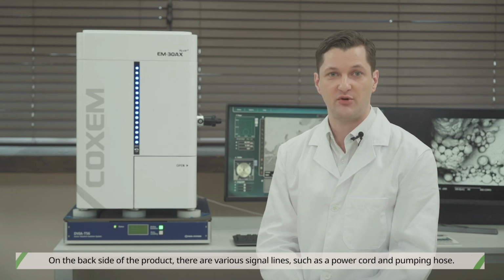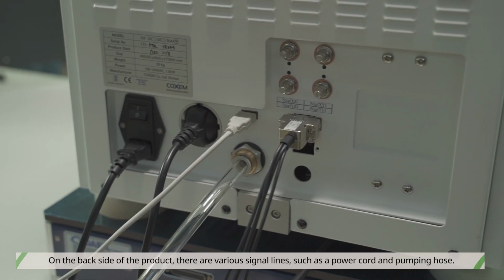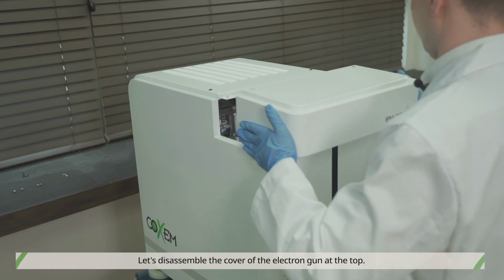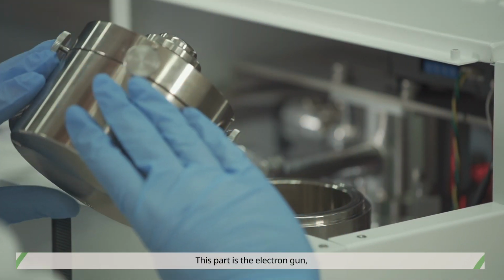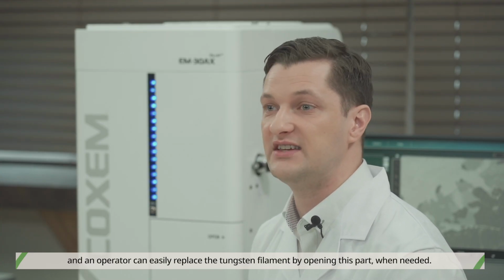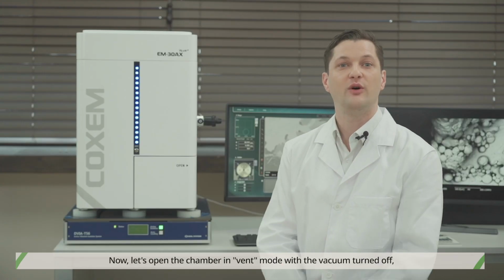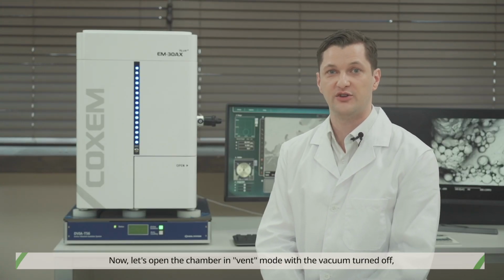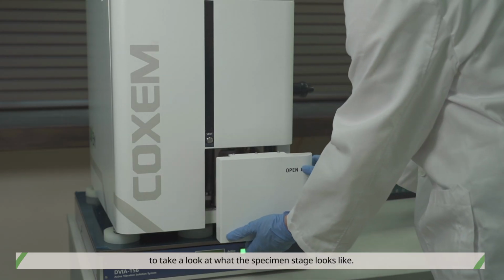On the back side of the product, there are various signal lines such as a power cord and pumping hose. Let's disassemble the cover of the electron gun at the top. This part is the electron gun, and an operator can easily replace the tungsten filament by opening this part when needed. Now, let's open the chamber in vent mode with the vacuum turned off to take a look at what the specimen stage looks like.